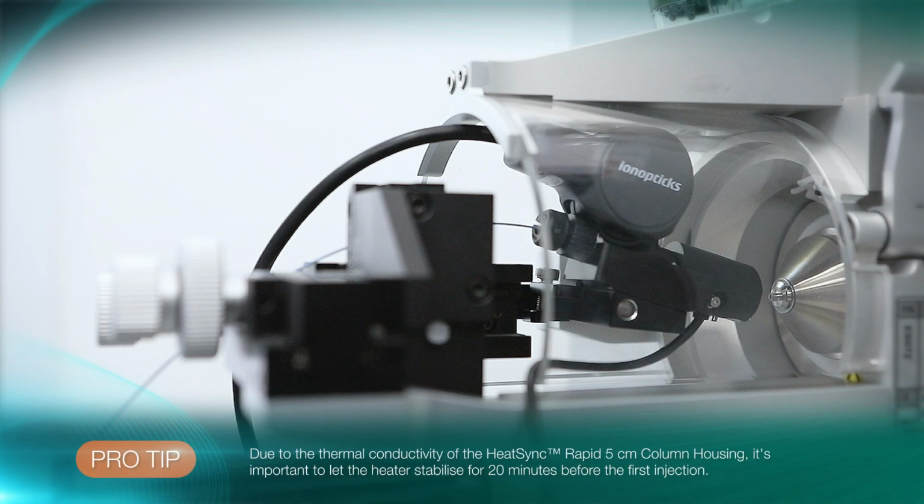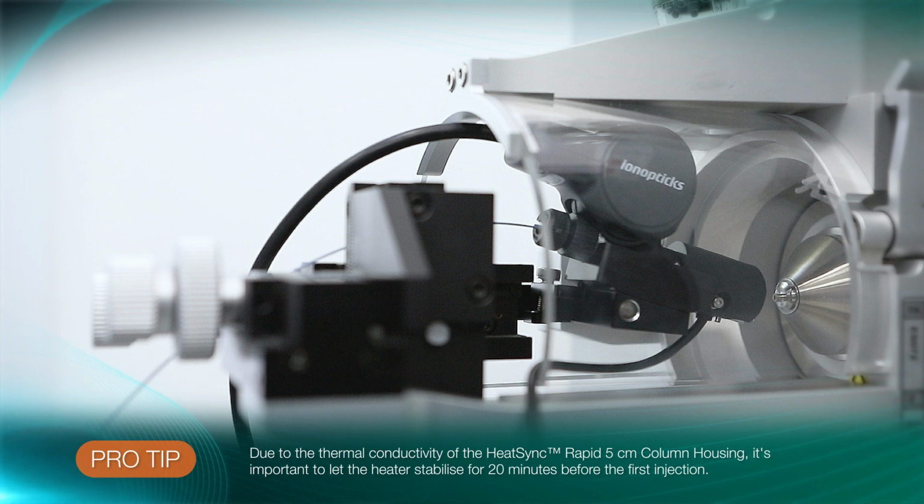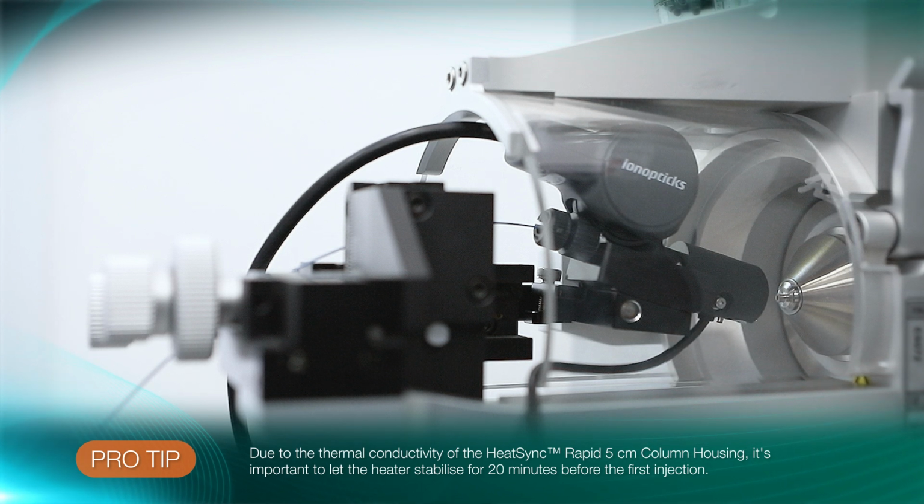Due to the construction and the thermal conductivity of the HeatSync Rapid column housing, it's important to let the heater stabilize for 20 minutes before the first injection. This ensures the heat is distributed evenly across the full length of the column barrel.